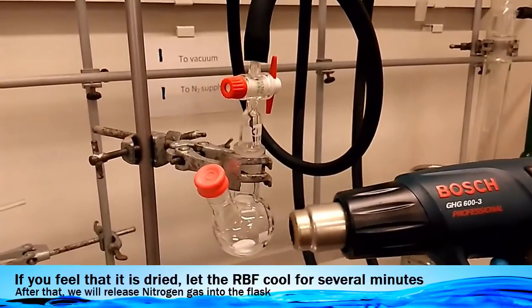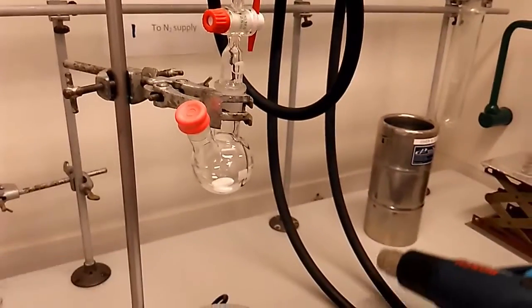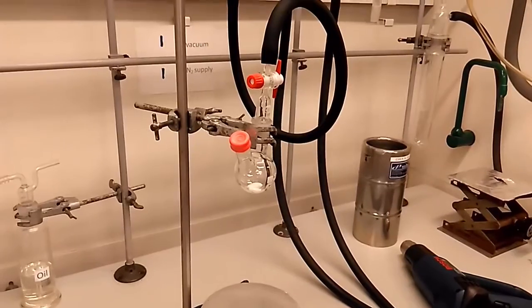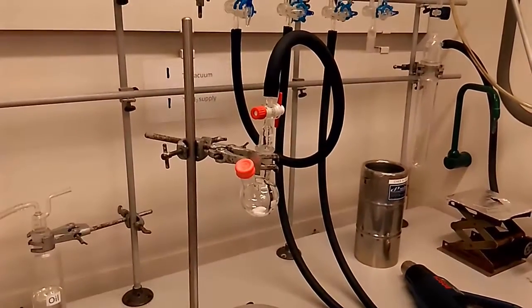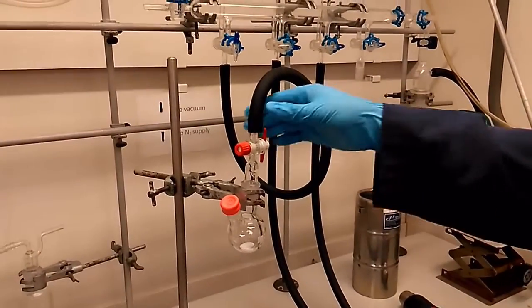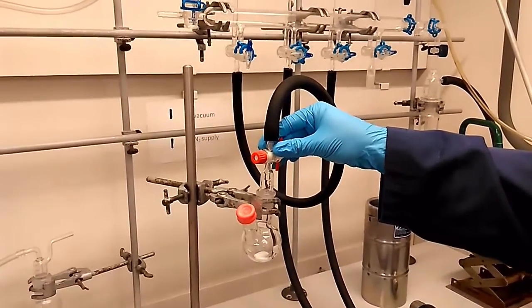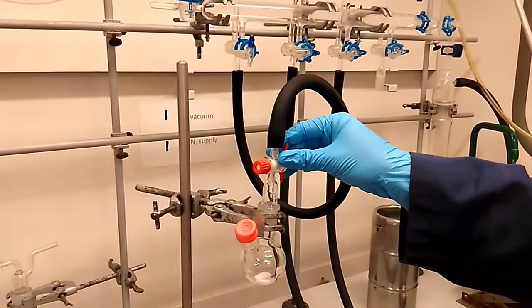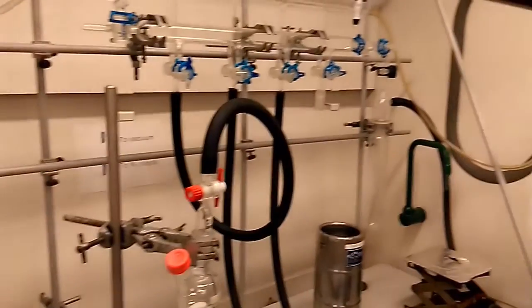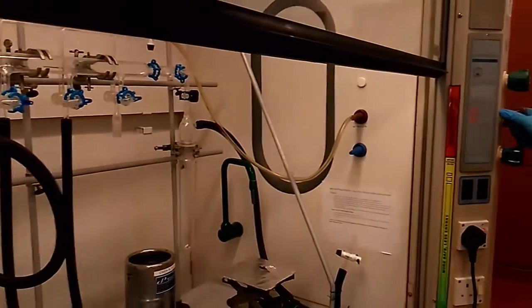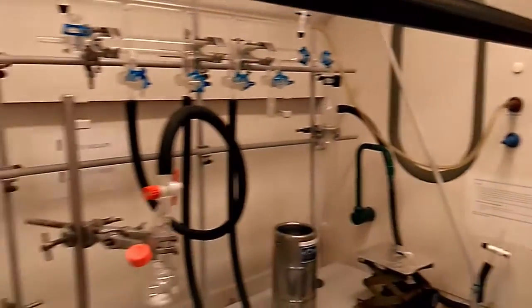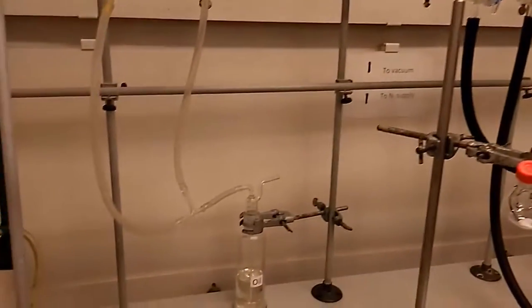So after waiting for one or two minutes, we will now turn on the nitrogen gas. We try to have a steady flow of nitrogen gas inside.